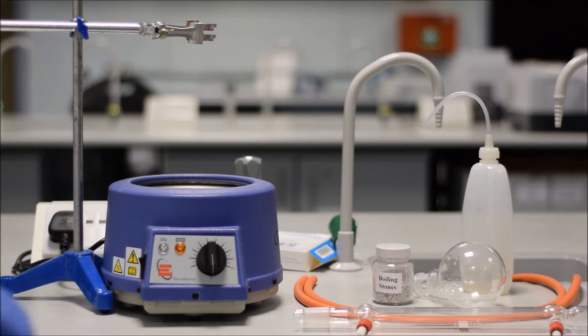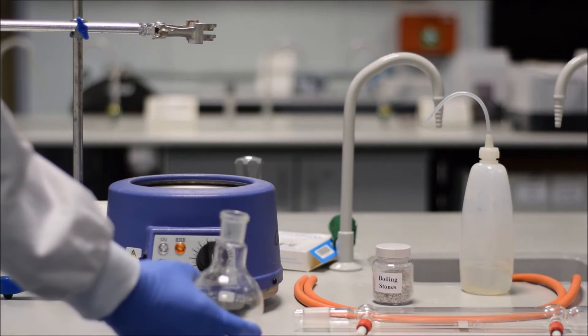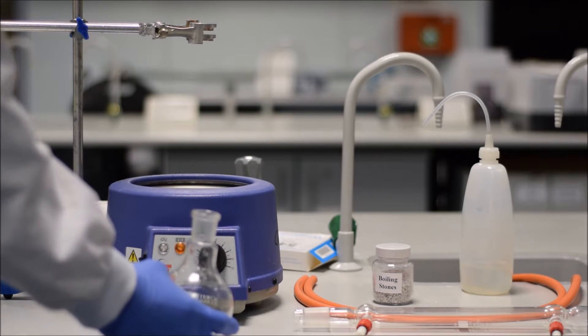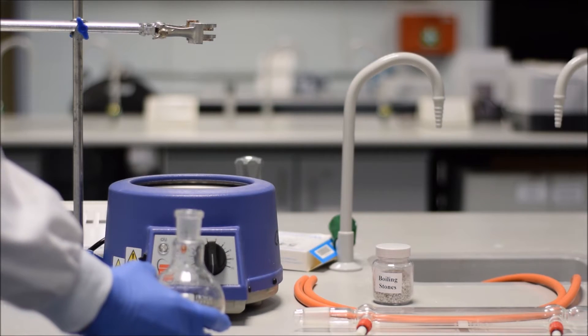Today we're going to learn about setting up a reflux. If we're doing a reflux, it's because we want to carry our reaction out at the boiling temperature of the solvent. So what we're going to try and do is boil our solvent, but not have it evaporate away, because otherwise our reaction is going to lose its solvent and bad things are going to start to happen.